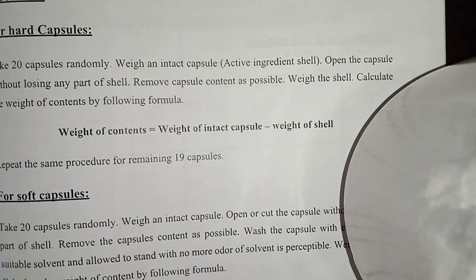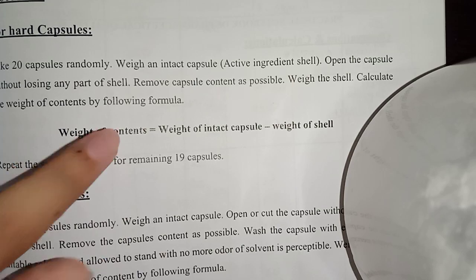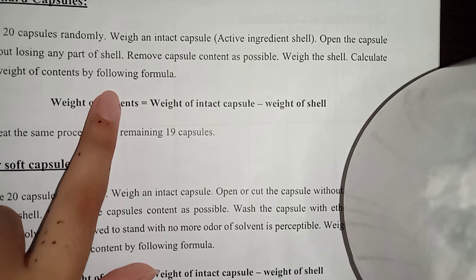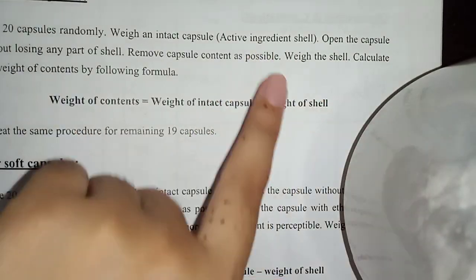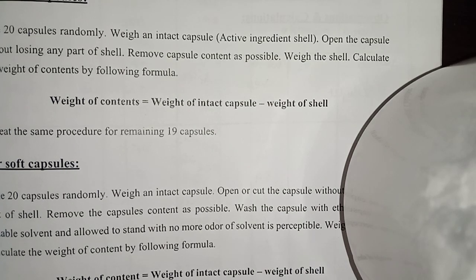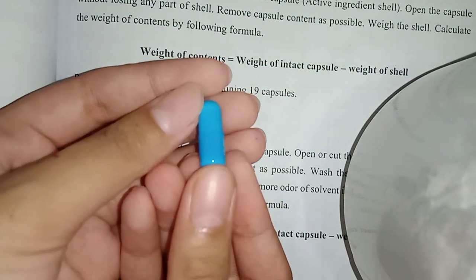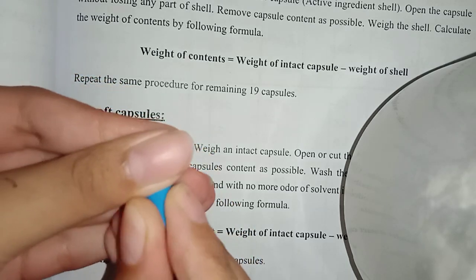After opening, remove as much content as possible from the shell. Then weigh the empty shell. Calculate the weight of the content using the formula: weight of intact capsule minus weight of shell equals weight of content.